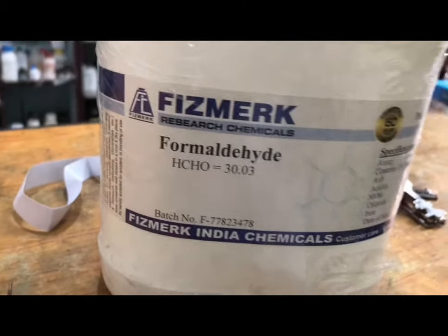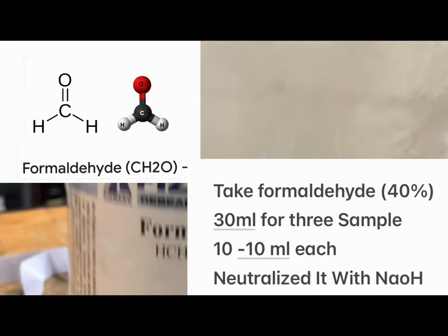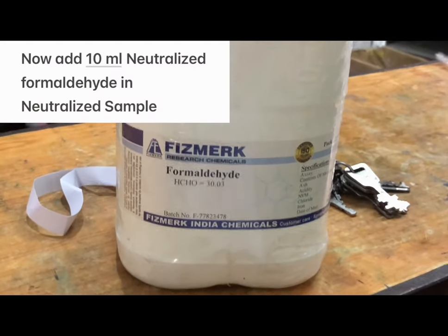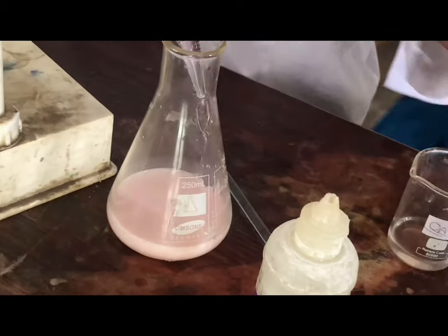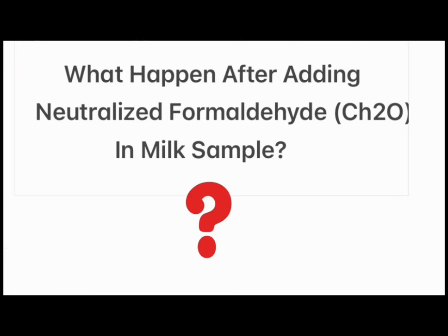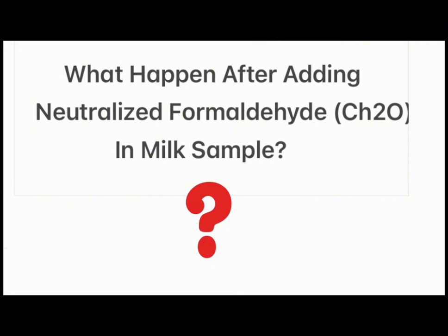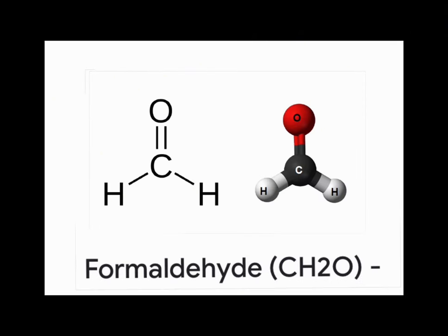After that we take formaldehyde. Formaldehyde has a small amount of acid. This is 10 ml of formaldehyde. Now let's discuss what happens after adding formaldehyde to the milk sample, and the formaldehyde structure.